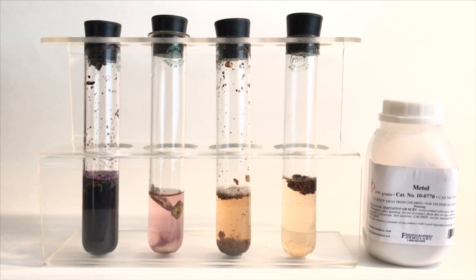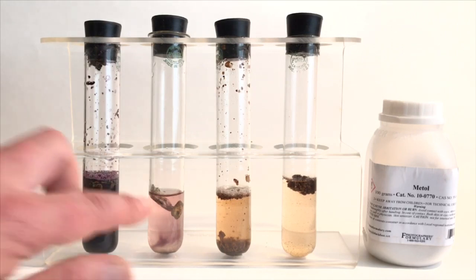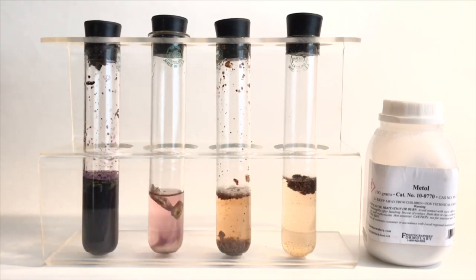So, you know, it's not the only test you'd want to use if you were out searching for mushrooms. You would use all of the regular field examinations, and then you could use this as a further test if you still weren't sure. Of course, once you've put these mushrooms in this liquid, they're now garbage. You can't ingest them. The metol is pretty toxic stuff.